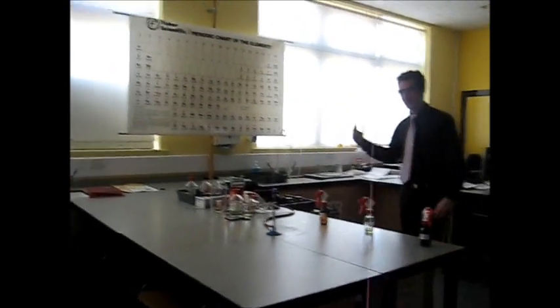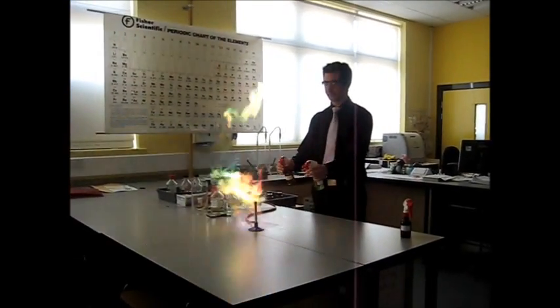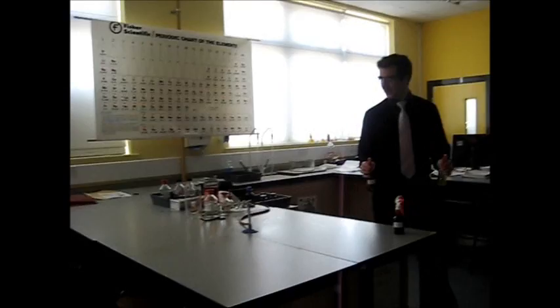The red's still there, even now. This is awesome. Why is it still there? Because it wants to be. Probably the wettest at the bottom. It's still... Woah. I am so mad.